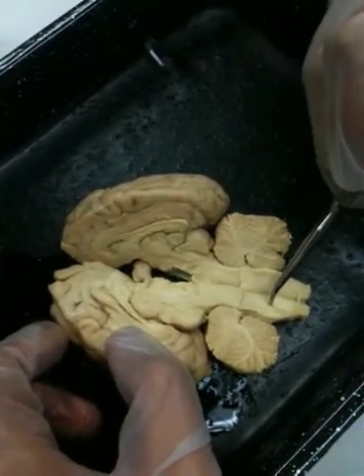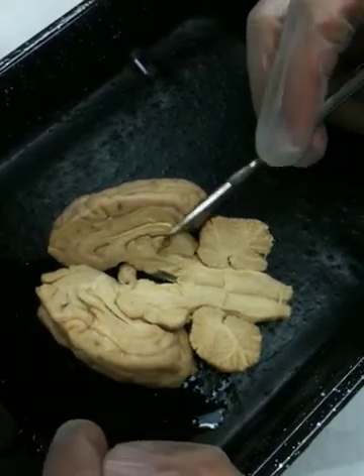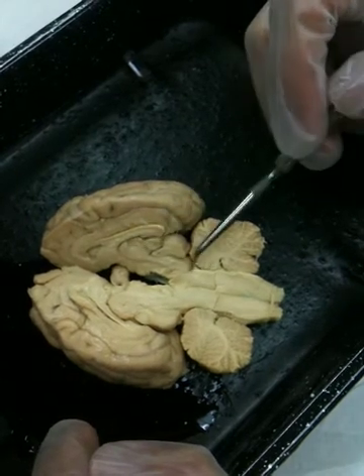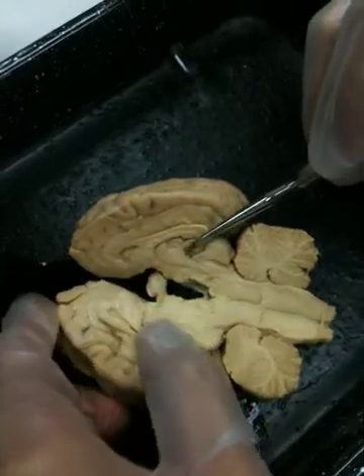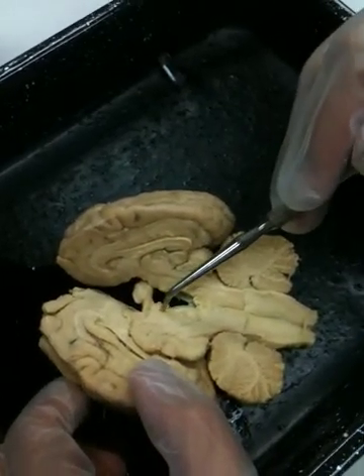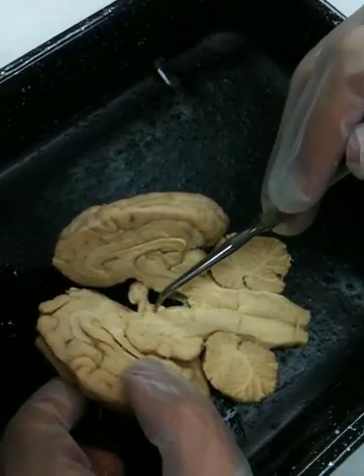Mammillary body is a structure which we can see from the outside as well. This next one I can show you on the outside view, but we can see it internally here as a structure that's been sectioned in half right there. Not this one, that's the optic nerve. When we look through the cranial nerves on the outside, I'll show you again where the mammillary body is on the outside, and you can compare that location to this inside location for the mammillary body.